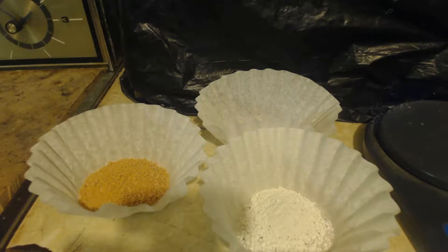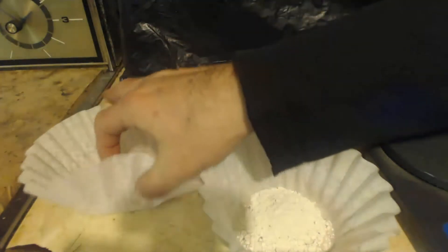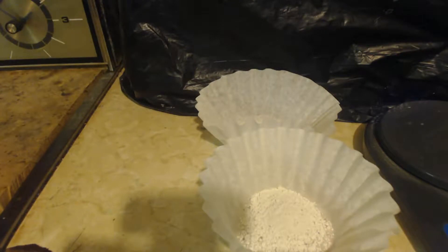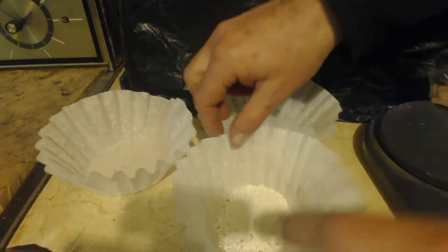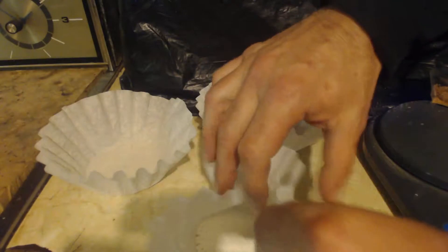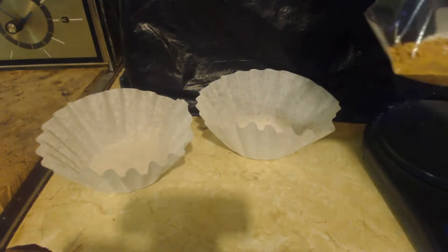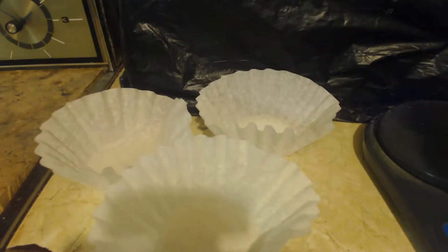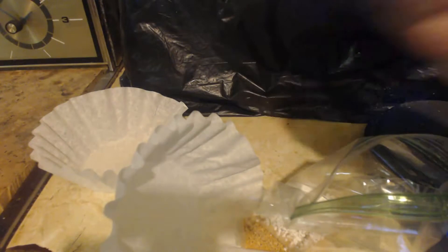This is John Bach's Superchemist. We're here to make some methyl benzene, most commonly known as toluene. I have some toluic acid here, about 15-16 grams. We've got calcium oxide here, about 16 grams, and then I got 22 grams of sodium hydroxide.